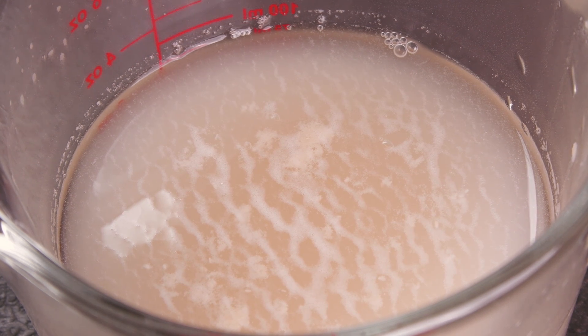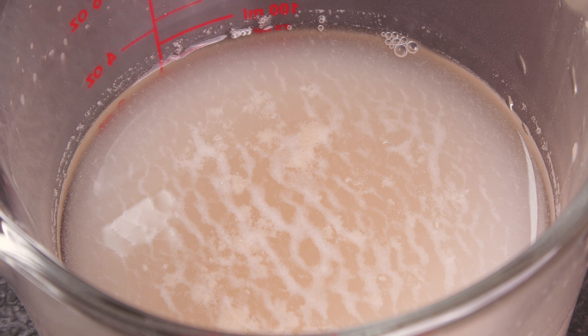If you wish, no matter how much yeast you use, this can be added to a clean and sanitary airtight container and stored in your fridge for use ideally within 24 to 48 hours, though you may still find it viable after a slightly longer period. However, you must avoid using it if it has any signs of mould or if it smells sulfuric, meaty, or like rotten eggs.